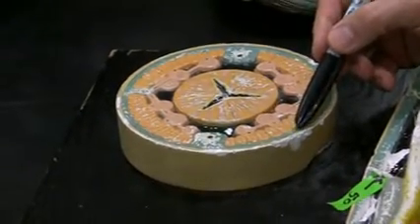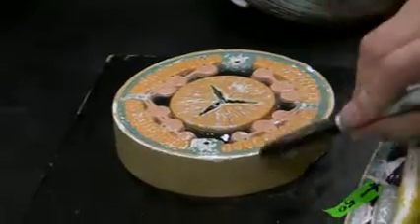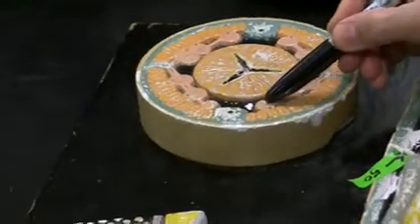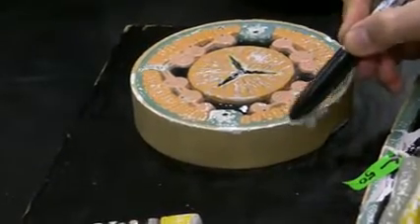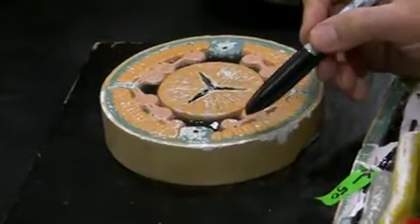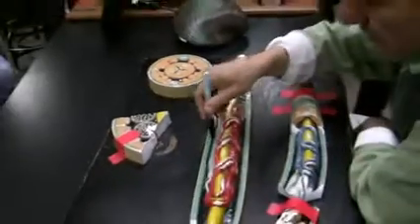Combination of longitudinal muscles and cuticle is called all of this. And hypodermis, this is the green. The green is hypodermis right here. The outside is cuticle. Green is hypodermis. Longitudinal muscles. Combination of all three of them together is called body wall. Right? It was somewhere in your notes. Okay, pseudocoelom again in here, so on and so forth.